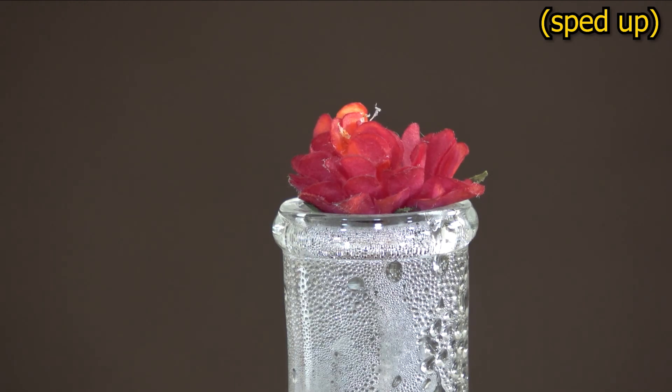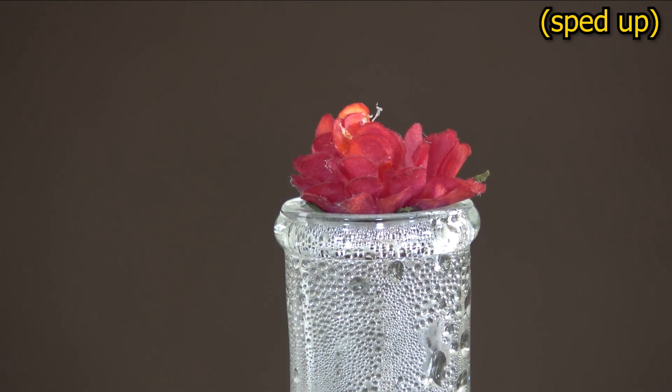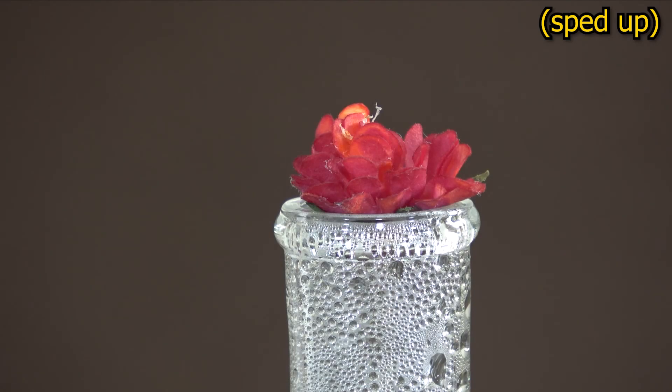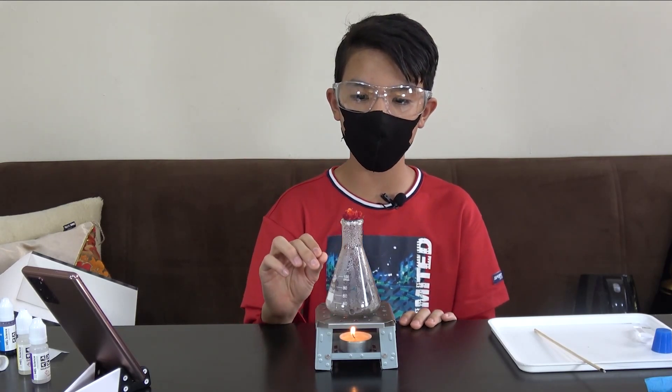You can observe this as a change in the indicator's color from red to yellow. Sulfur dioxide isn't the only sneaky acid-forming gas. Nitrogen dioxide from the neighboring experiment does something similar — it binds with water and forms two acids: nitric and nitrous acid. Sulfur dioxide and nitrogen dioxide are common air pollutants, and their ability to make water acidic is what causes so-called acid rain, a phenomenon just as nasty as it sounds. Some gases, however, do just the opposite — ammonia gas also binds with water but forms a base: ammonium hydroxide.